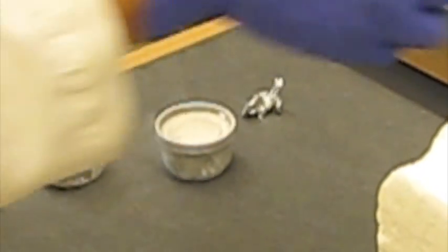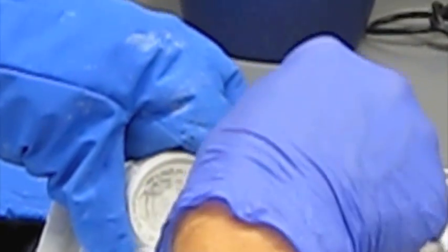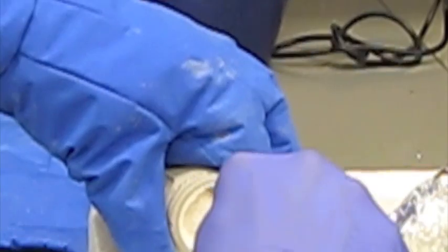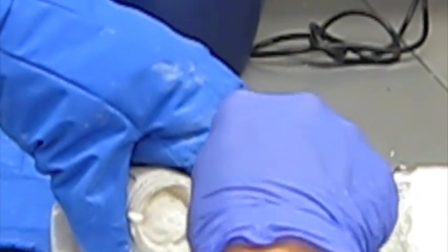There's our nice busted-up yeast. Now we're going to take that and put it into the beaker. We make sure our spatula is nice and cold, then we go inside and just scrape this off. We have to watch out for the ball bearing so it doesn't fall out — scrape some out of the edges first. Then it looks like the ball bearing is really loose, so I'll transfer it to the other half of the holder.